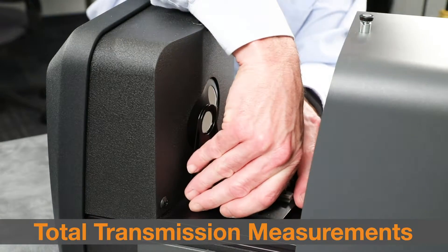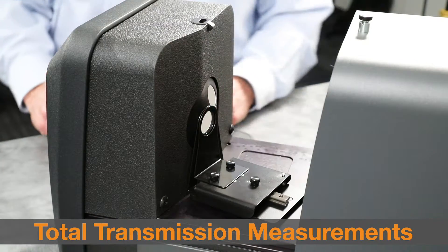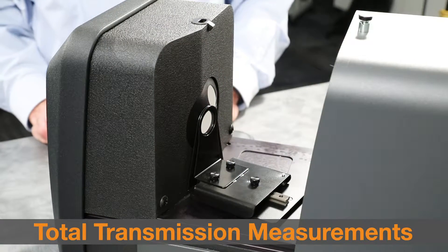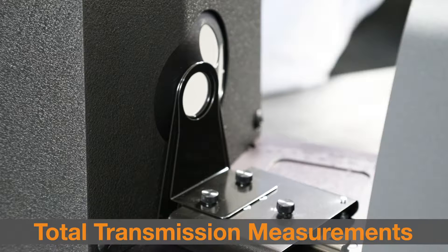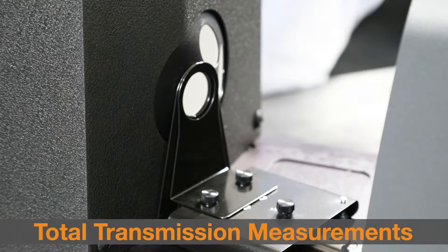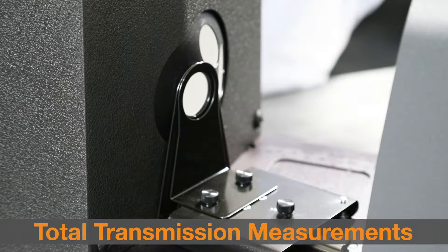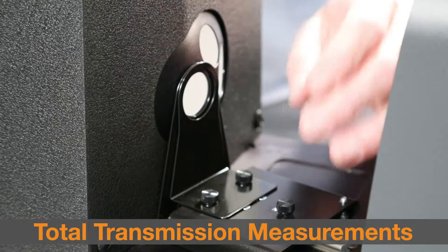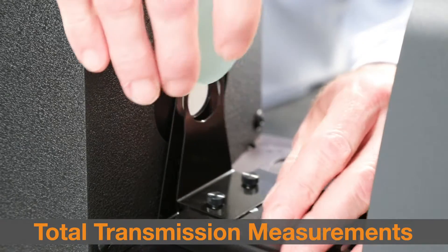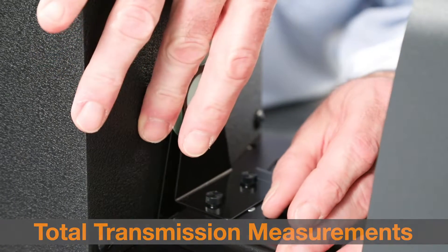Total transmission measurements are appropriate for measuring translucent samples which exhibit some scattering of the light. These measurements are taken with the sample positioned towards the sphere. Pull the clamp back and position the sample between the clamp and stop.